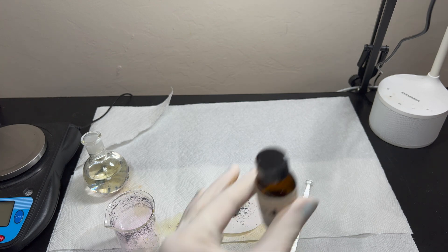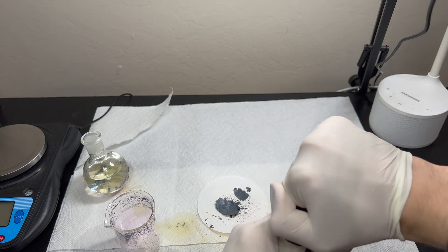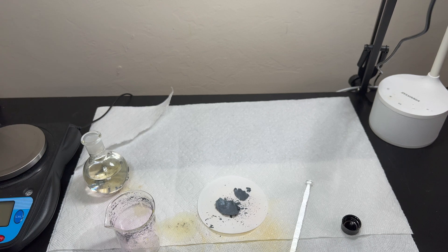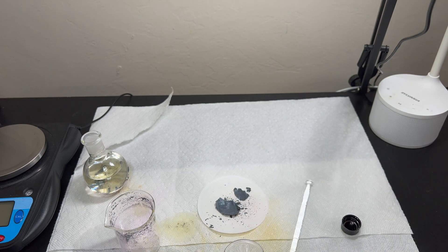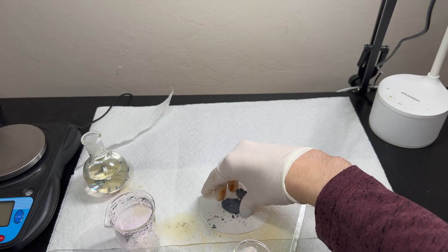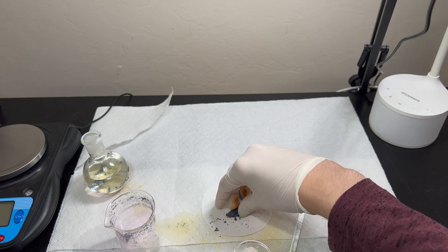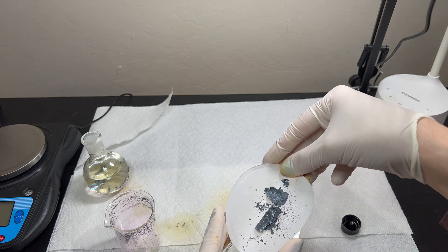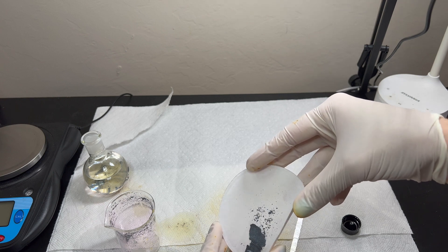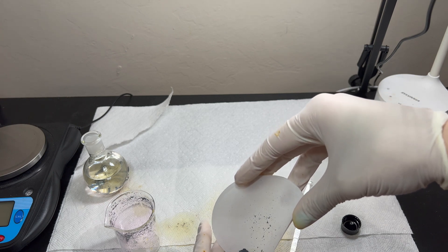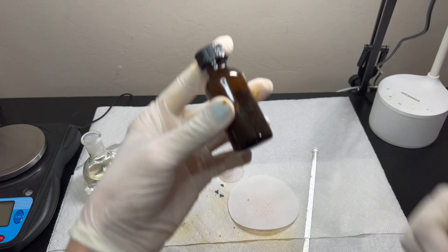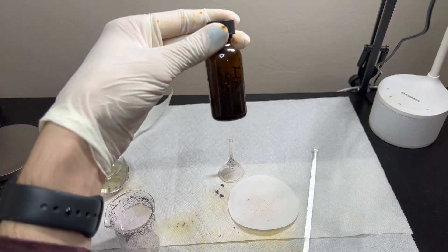So, now you take an amber bottle, and I have one that already has iodine in it, and a funnel, which I have in a cabinet. Actually, I need a smaller funnel for this. And then go ahead and start pouring your iodine in there. Now, I'm just going to break this up. Usually, it doesn't come out this way. This is the first I've actually seen it come out like that. But, you take the filter paper, and very, very carefully start pouring it in. And then, there's your iodine. Obviously, this is a lot more. I had stuff in it previously, but it's stored in amber bottle, because it protects it from UV rays.